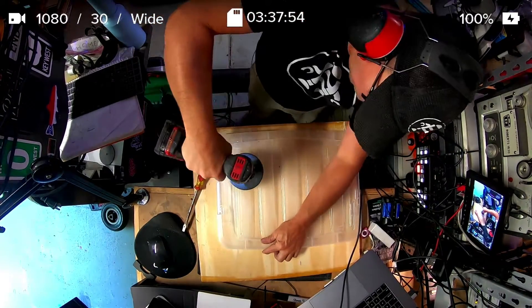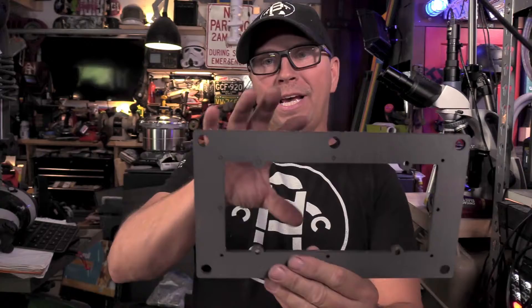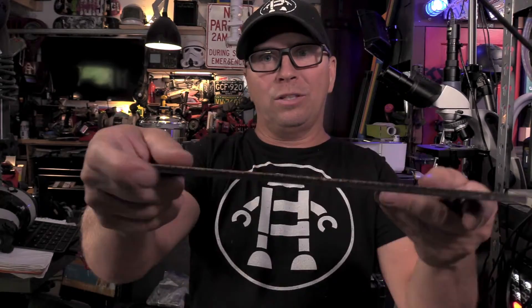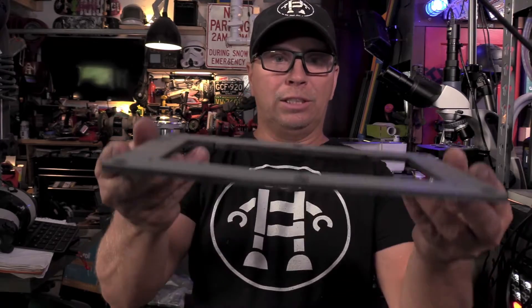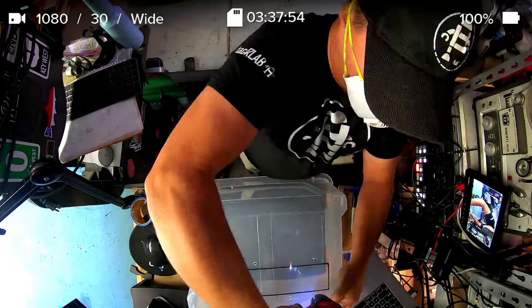The first thing I did was go through a couple different prototypes to get the frame right. I designed it in Adobe Illustrator, then cut it out using some old flooring that I got from the dump — flooring materials are so expensive right now. I went ahead and spray painted it to seal it up nicely. I was a little nervous about foam cutting for the gasket, so I removed the breadcrumb tray of my Glowforge. The settings I used were 0.1 for the depth, a slower speed around 200, and power at 80.